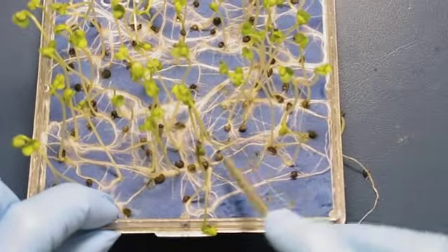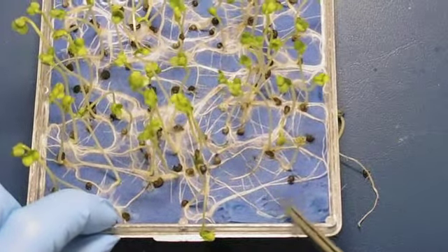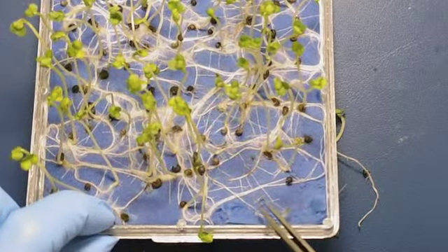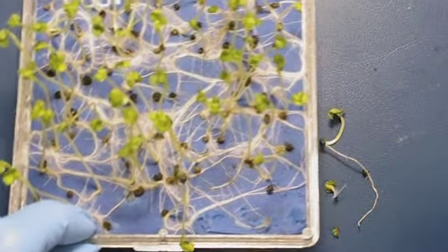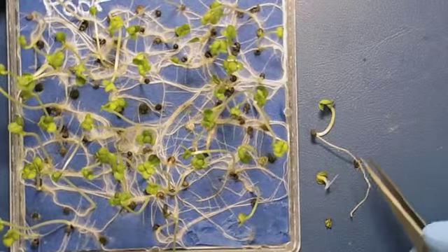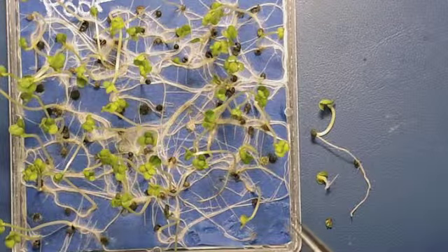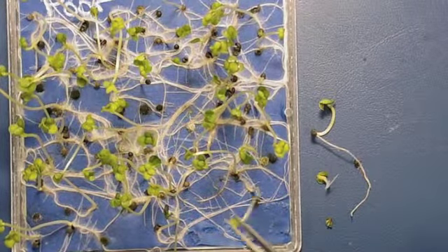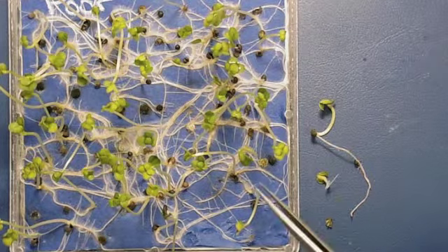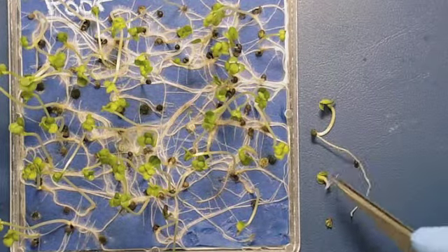with all the root development, but when we get a spot like this, this indicates that the seed has died and hasn't taken up any real estate. Now here I've taken off some of the abnormals. Now I know from counting this previously that the germination on this is 65%, and there's a couple of things that are actually going on with this.